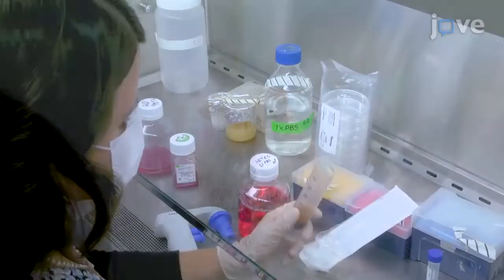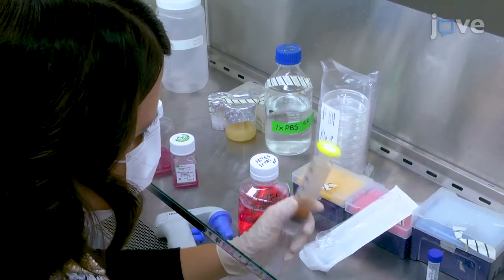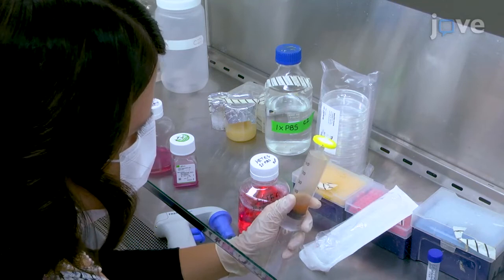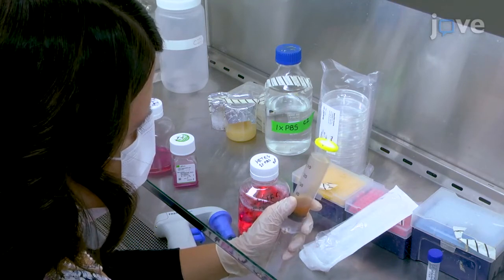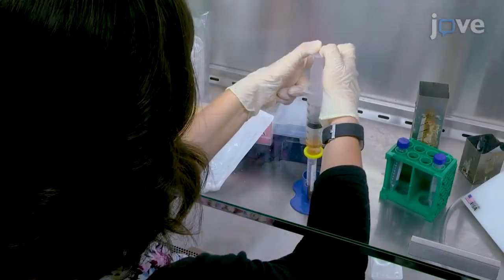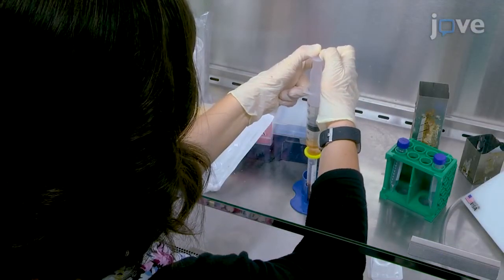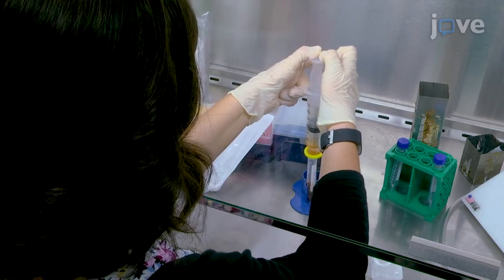To remove microorganisms and insoluble particles from the medium, filter it through a 0.22-micron filter. Then transfer the medium to a closed, sterile tube.